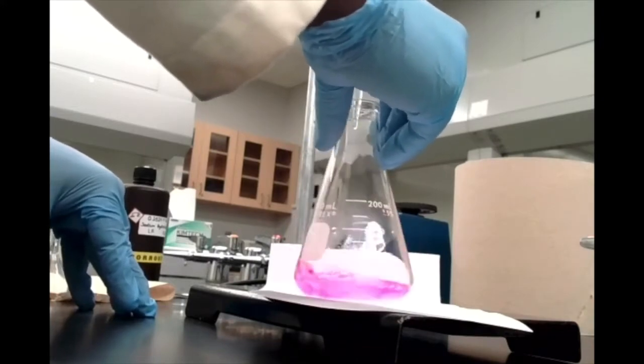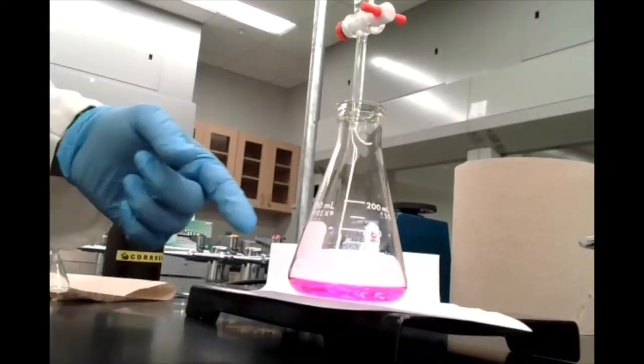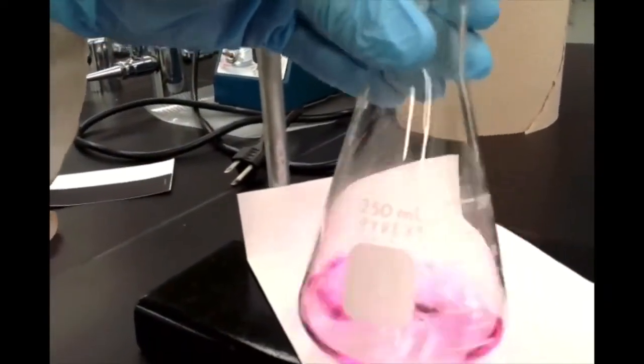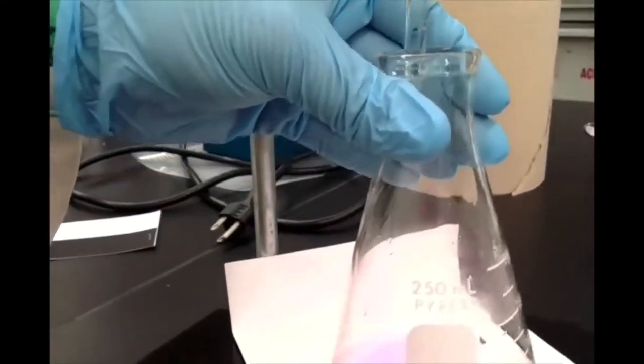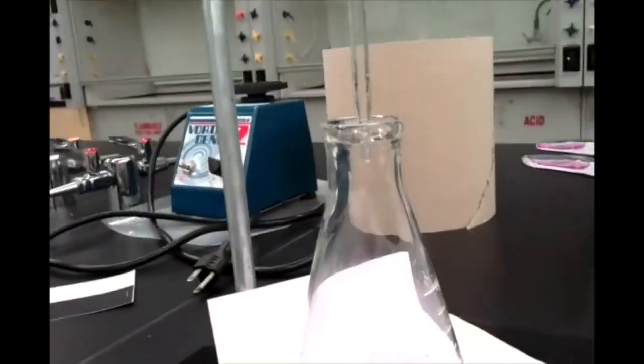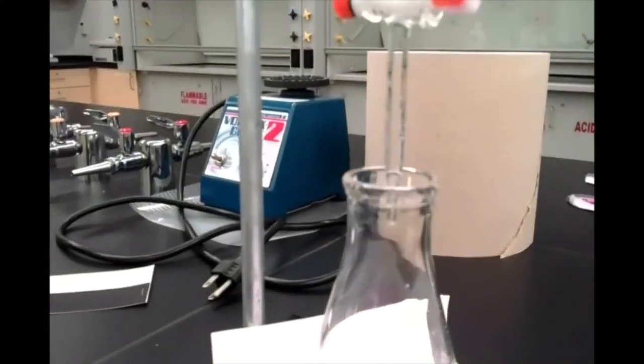It was colorless when I was swirling this, and you can see that we have this nice light pink color that's staying, no matter what, even with swirling this flask. Okay, that's probably a good endpoint then. So let's make a note of that volume, our final volume here. Oops. So hopefully that should show up. But again, I'll take a picture with my phone, so hopefully it'll be a little bit easier to read.